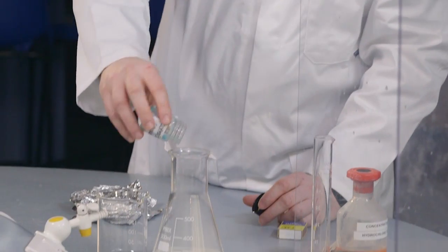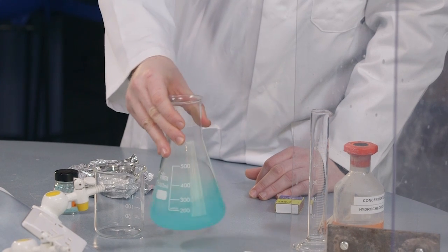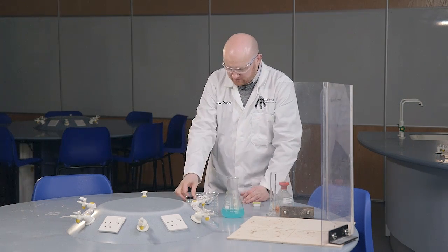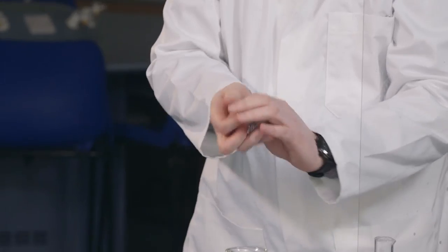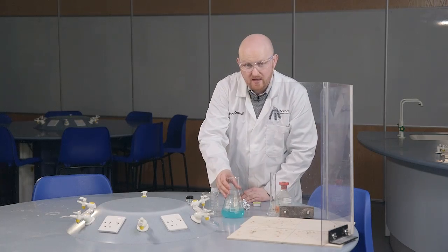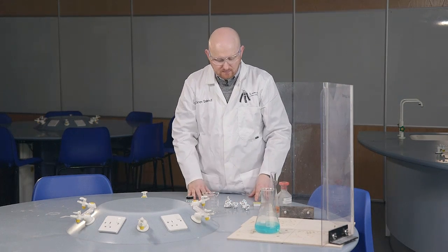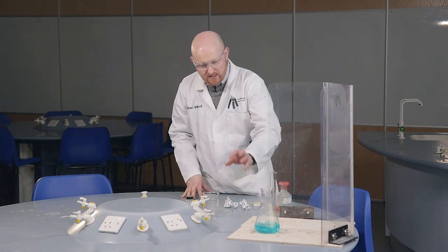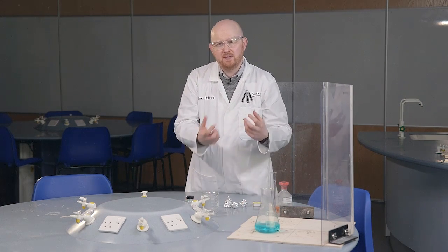Then we add our copper 2 chloride, and give it a swirl just to dissolve it. Now we have our aluminium foil, which we're going to scrunch into little balls. We'll put our conical flask onto the heat-proof mats and add the aluminium balls to the solution. The hydrochloric acid will get rid of the oxide layer on our aluminium, which allows our aluminium and copper to react.